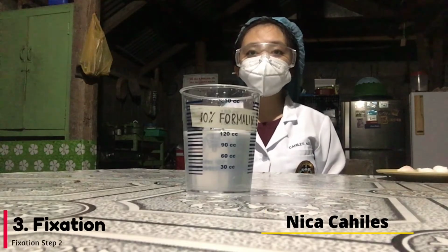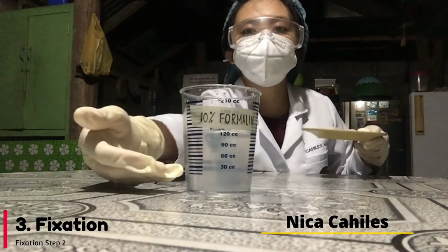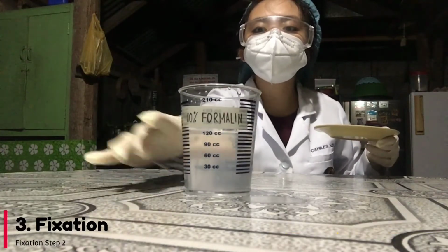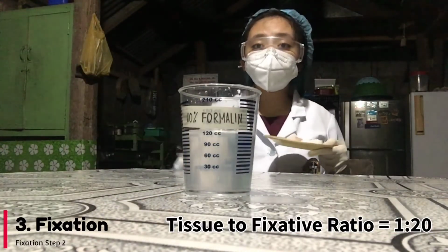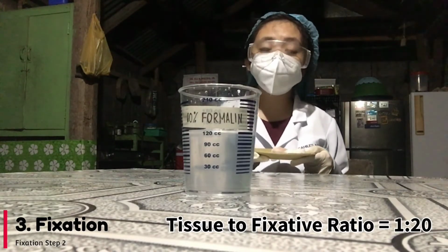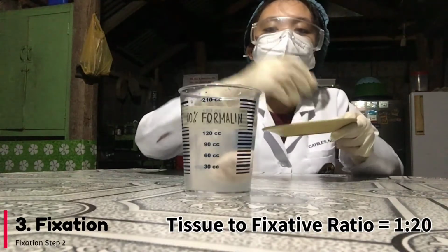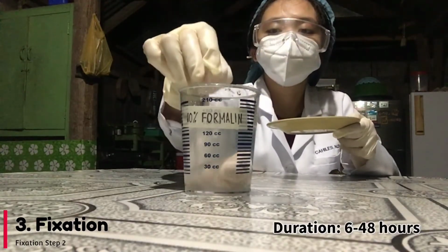The next step is the fixative process, where we are going to soak our cut sections in our fixative. For our fixative, we're going to be using 10% formalin, which is also called the universal fixative because it is the most common and most widely used fixative. So we're just going to soak our specimen in our fixative.